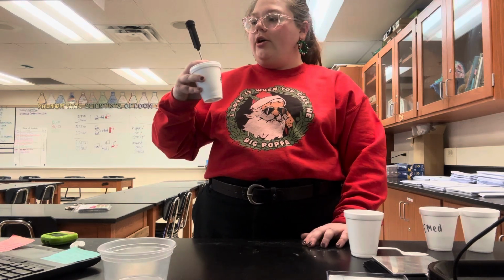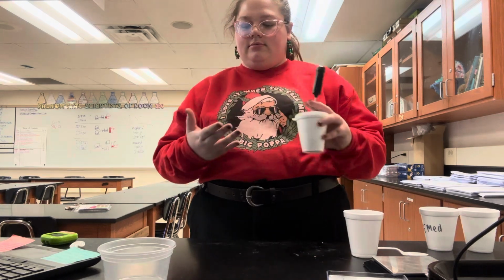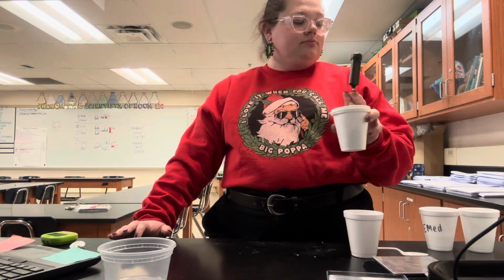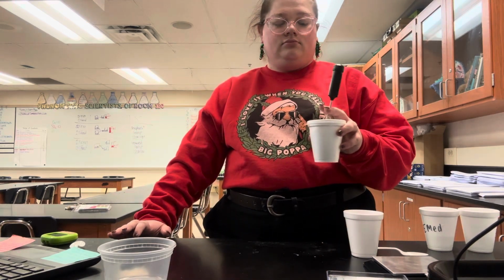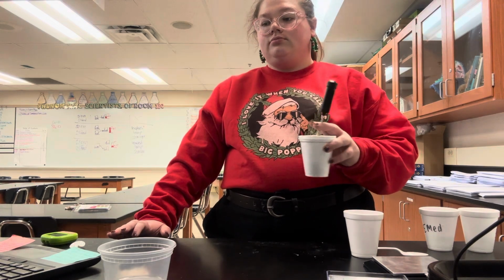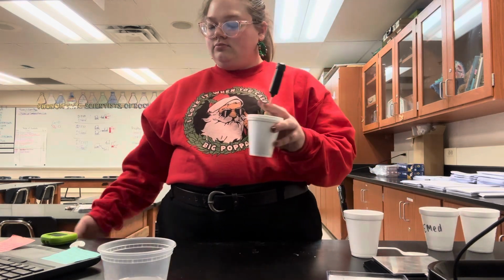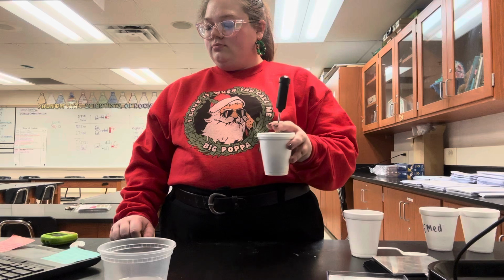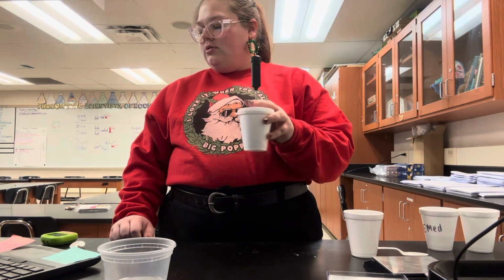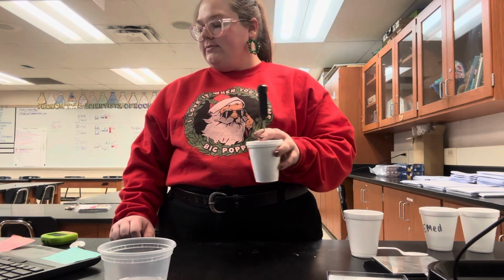Two minutes in, we are at 19.1 degrees Celsius. Two and a half minutes, we are at 21.0 degrees Celsius.